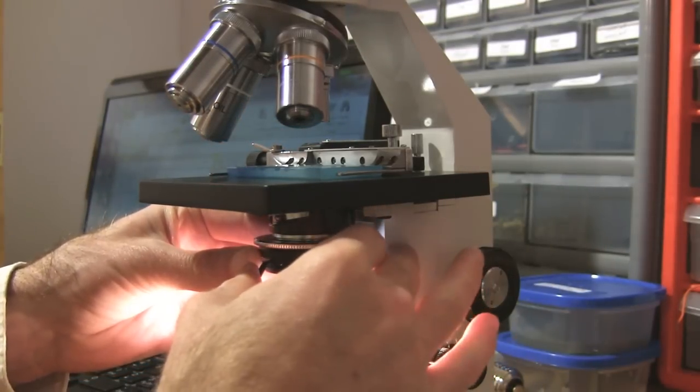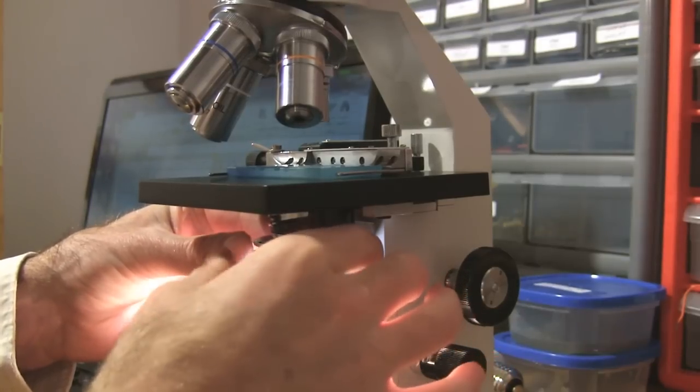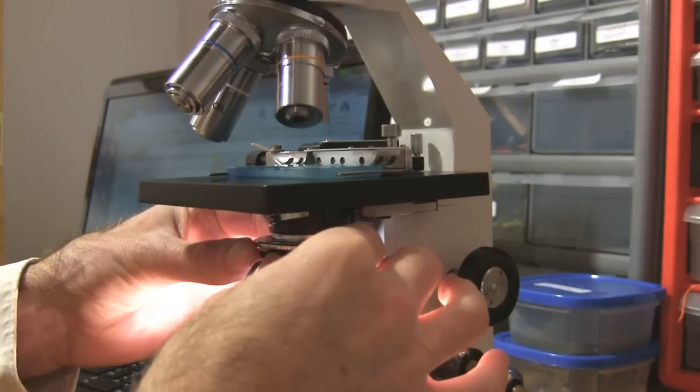And also with that diaphragm all the way closed, you'll want to adjust your light source. Make sure it's straight up and down. And also adjust the focus of your light source. You'll see a fine grain in the middle of the field when it's focused.